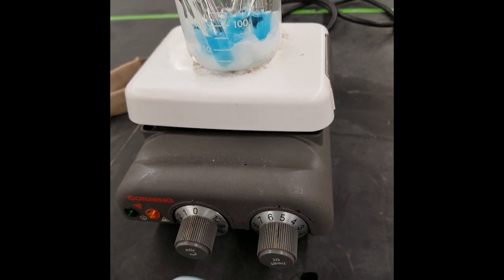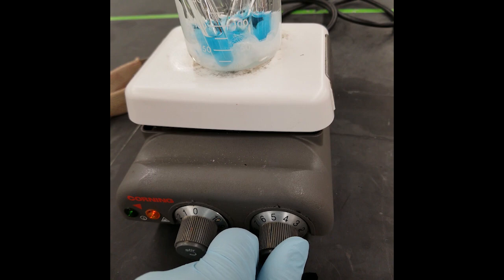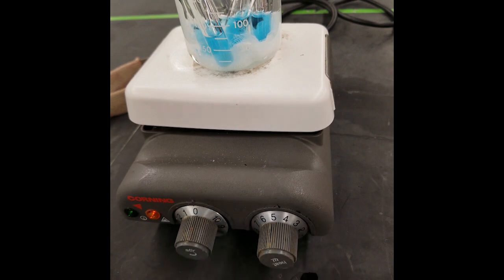Instead, closely monitor the beaker and make sure that it doesn't boil too vigorously as the temperature climbs back up over the next two to three minutes.